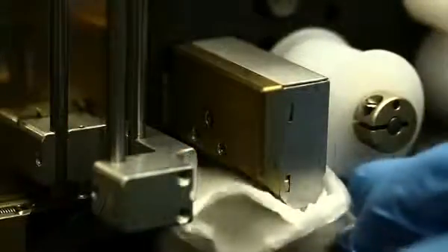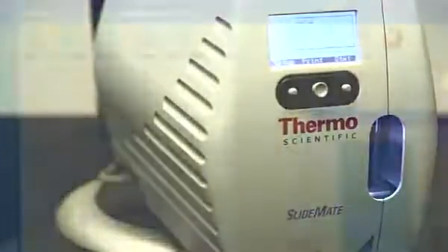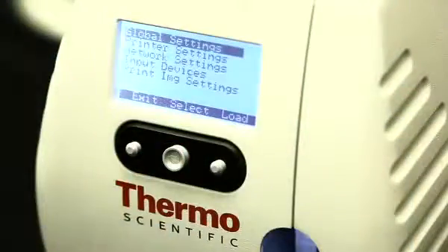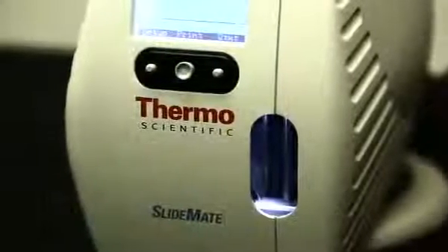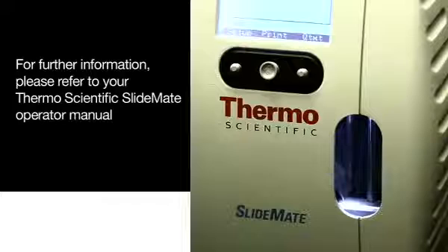We have just demonstrated techniques and practices that will help assure trouble-free operation and improved performance of your Thermo Scientific SlideMate slide printer. In addition, steps to take in troubleshooting and resolving issues were explained to return the instrument to service with minimal disruption. For further information on the features, operation, and maintenance of the SlideMate, please refer to your Thermo Scientific SlideMate operator manual.